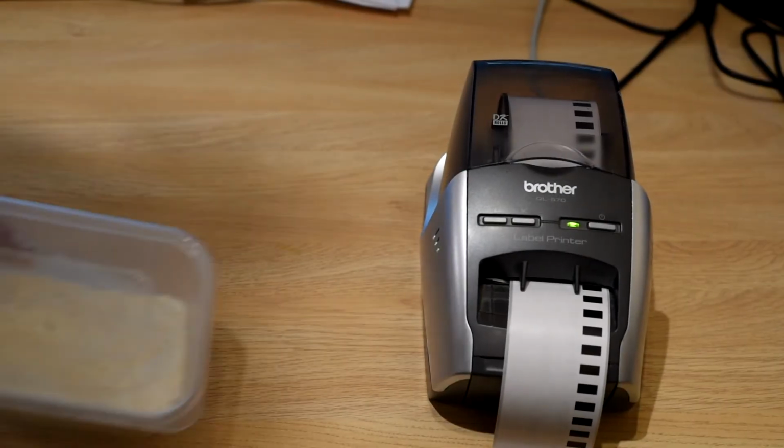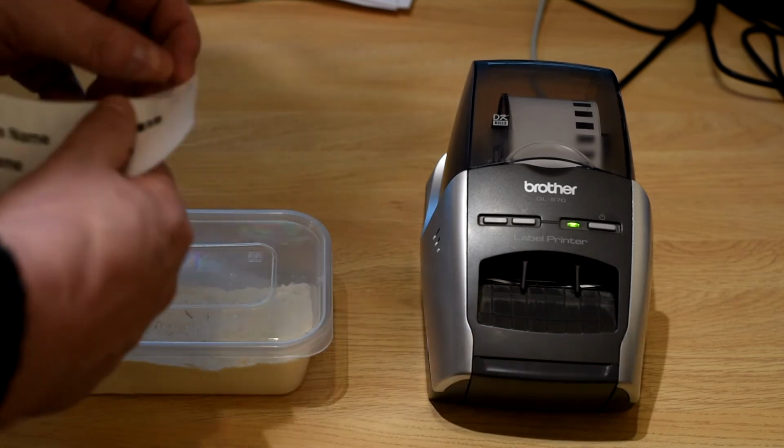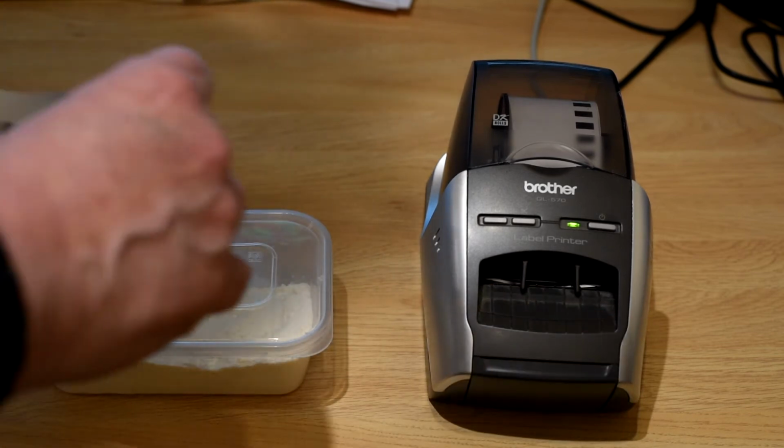Barcode reports can also be sent to label printers, ensuring sample integrity as it passes through the production or QC process.